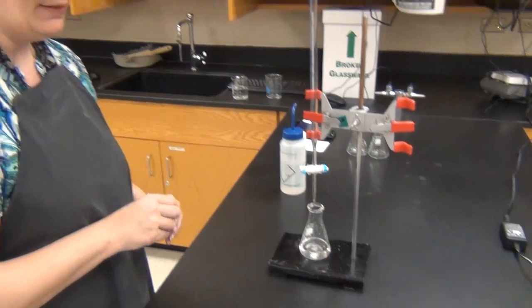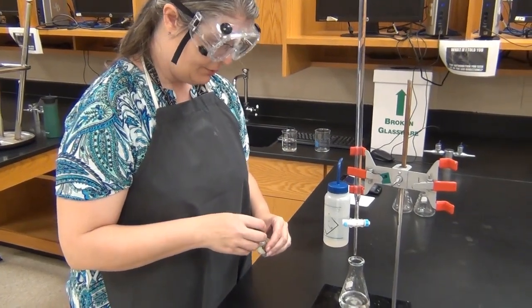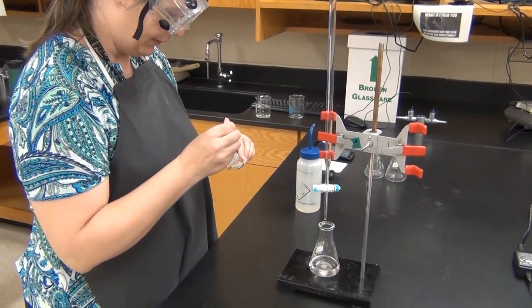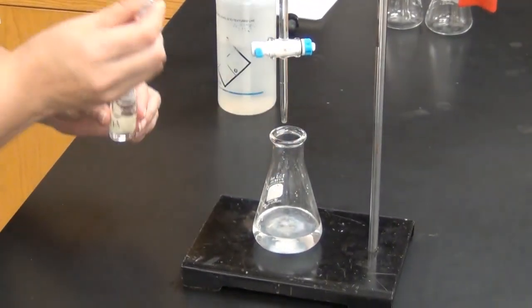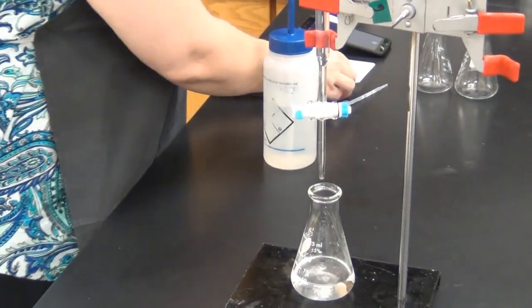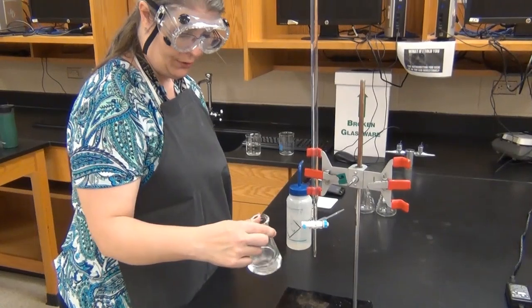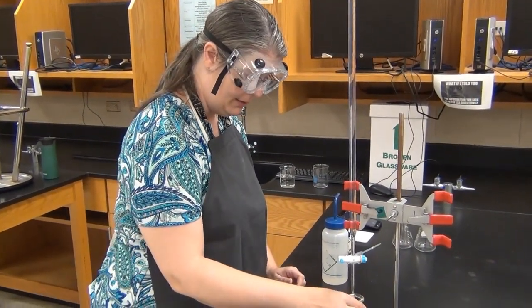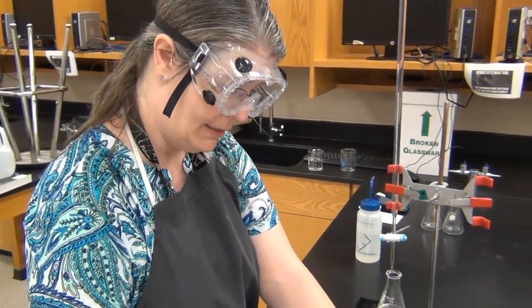There's a very important step I can't forget. I'm making a clear colorless solution, I have a clear colorless solution in the burette, and the products — water and a dissolved salt — are also clear and colorless. So if I want to see when the reaction is over, I need to add an indicator. The indicator I'm using is phenolphthalein, and I just need a couple of drops. Phenolphthalein is colorless in an acidic solution and will turn pink once I reach a basic solution — once I've neutralized all the acid and added just a tiny bit of extra base.